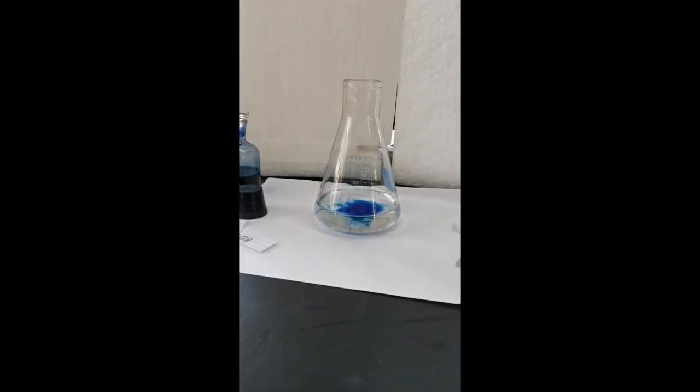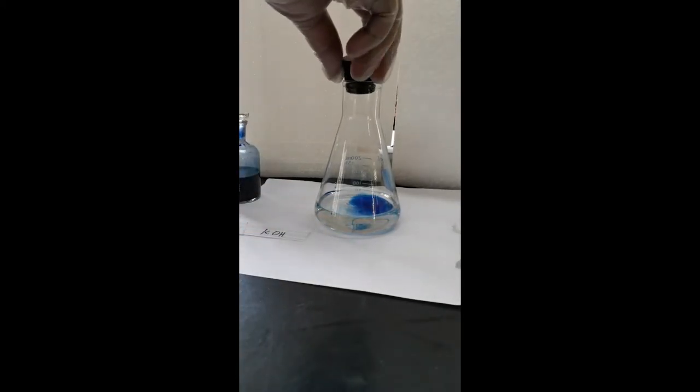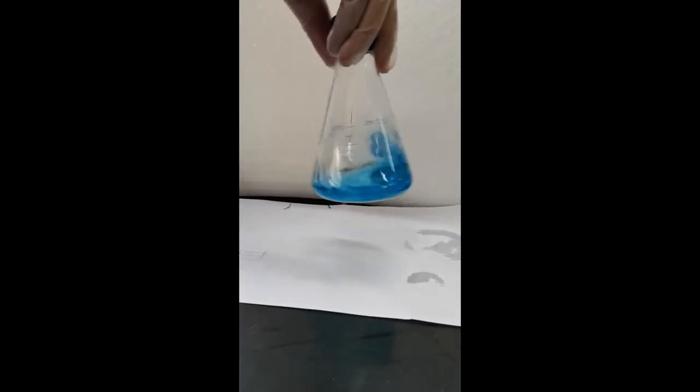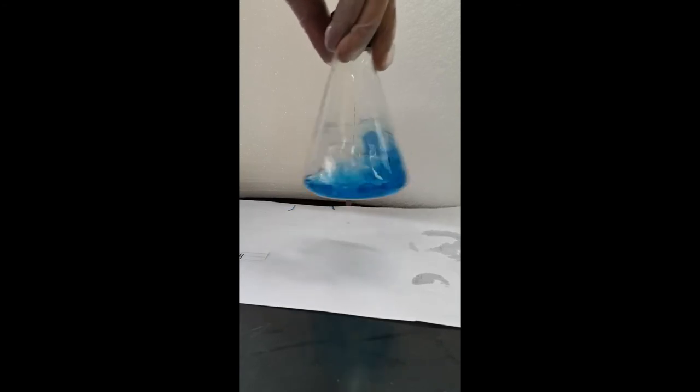Put the stopper on and shake the flask vigorously. Observe the change in color.